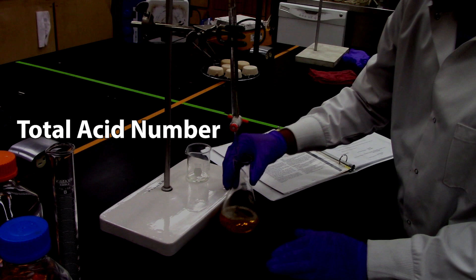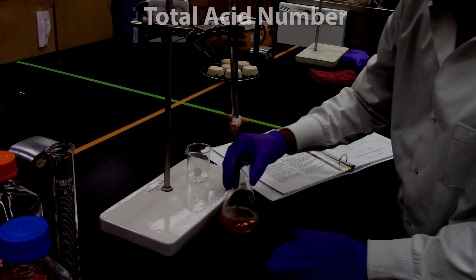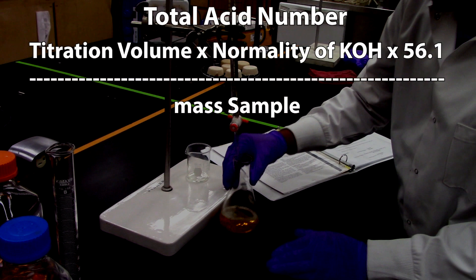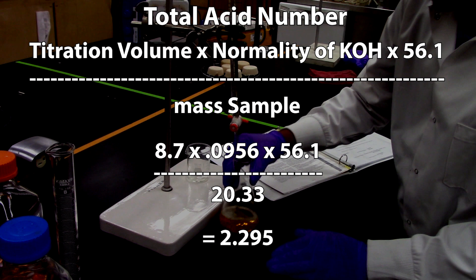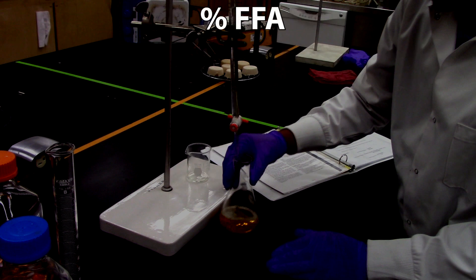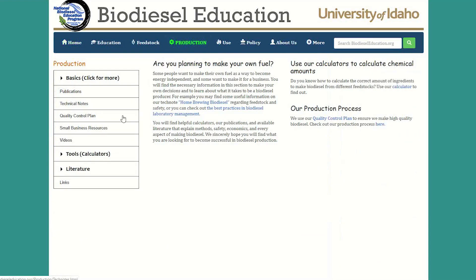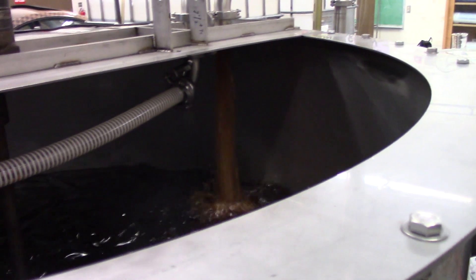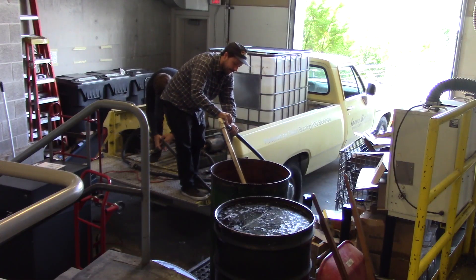To get the total acid number, you take the milligrams of potassium hydroxide used in the titration and divide it by the grams of the sample. This is the same as taking the titration volume multiplied by the normality of the potassium hydroxide, multiplied by 56.1 — the molecular weight of potassium hydroxide — and dividing this entire number by the mass of the sample. To get a percentage FFA, if your oils are mostly oleic, take the total acid number and divide it by 1.99. We have a calculator on our website that will crunch this number for both mostly oleic acids and mostly lauric acids. If your percent FFA is higher than 3–5%, you probably want to pre-treat your oil before turning it into biodiesel.